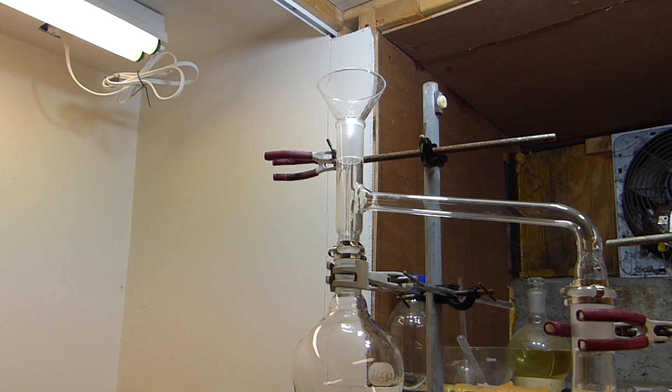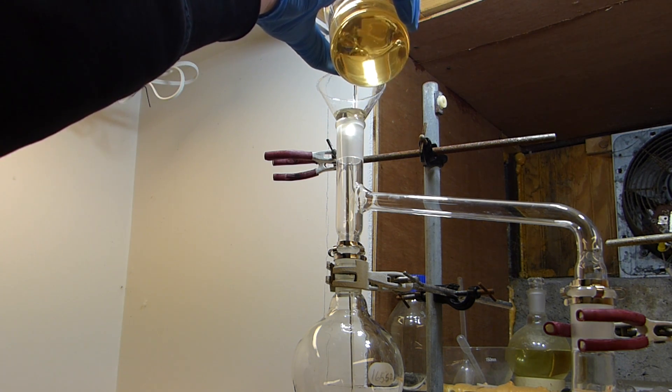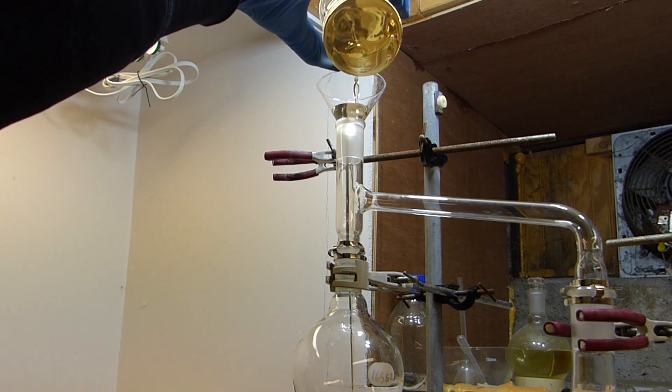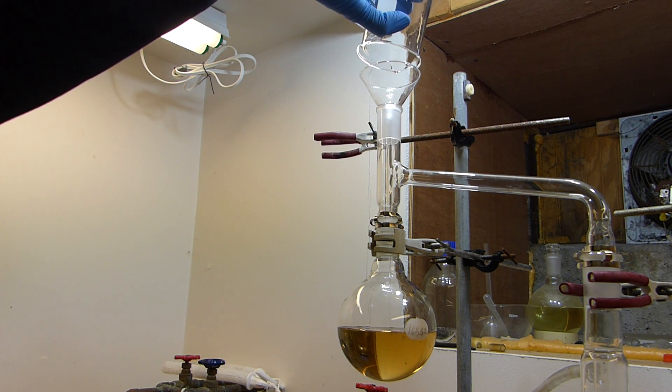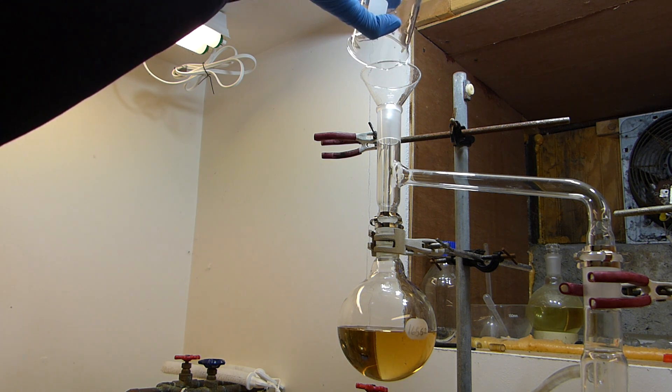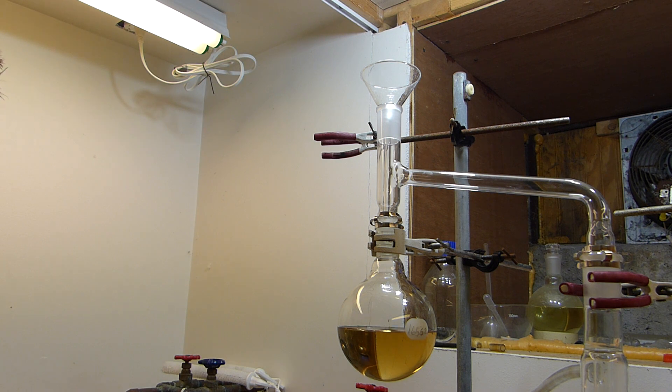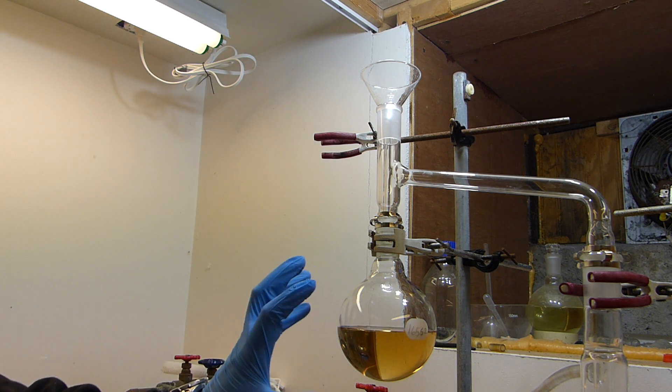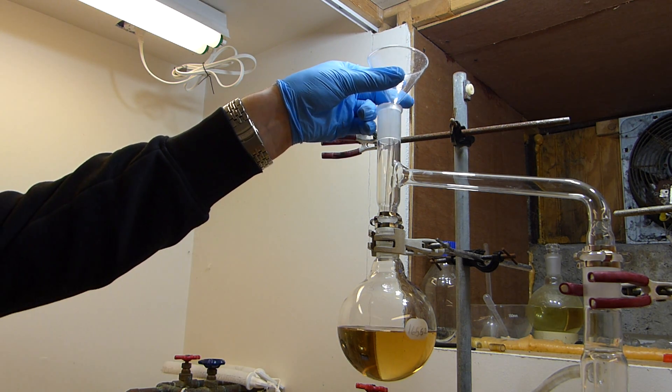However, for today, I won't be doing it like that. I just set it up like I've done it in the past. I'm only going to make about 250 milliliters. So I'm going to go ahead and charge that with this beaker here very carefully because obviously it's sulfuric acid and it's very concentrated. Now because of the very large temperature change that this sulfuric acid is going to experience, you kind of need to charge the acid about 15% lower than you'd want the maximum level in the flask to be.